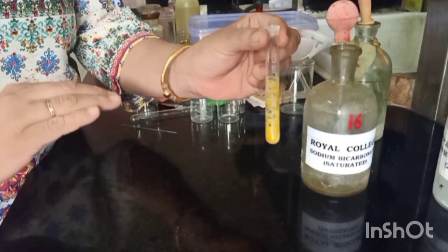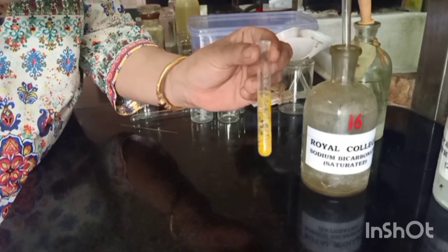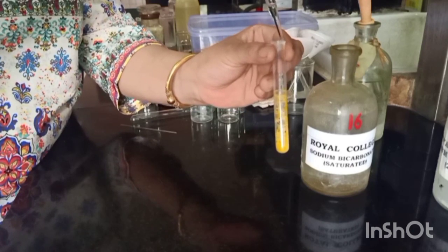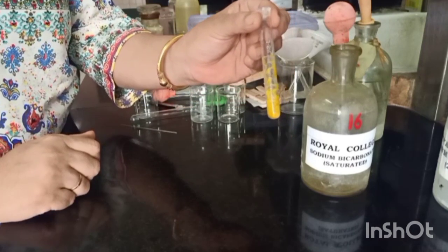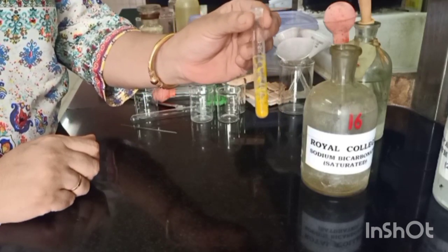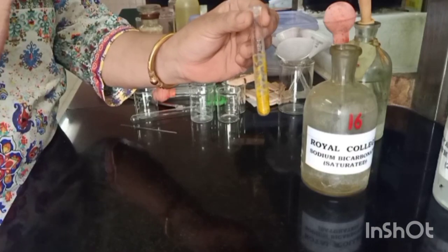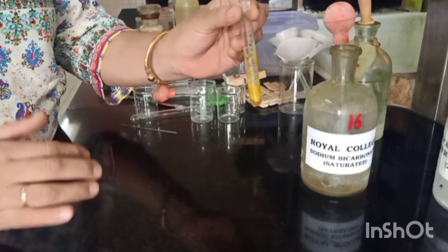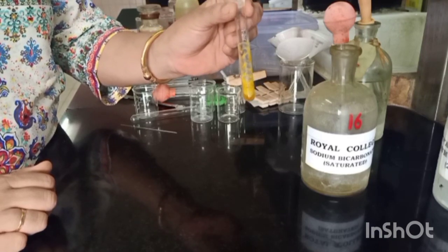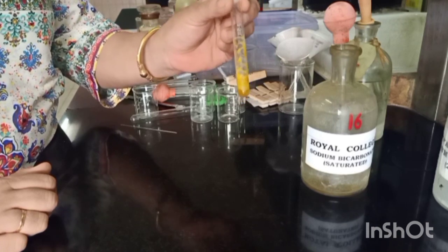We will just wait for the effervescence to subside and add sufficient bicarbonate to dissolve all the acid. This is important because we want to separate out component A, which is our acid, completely from the other component. Otherwise it will interfere in the test later. Hence we must ensure that the entire component of acid is dissolved completely.